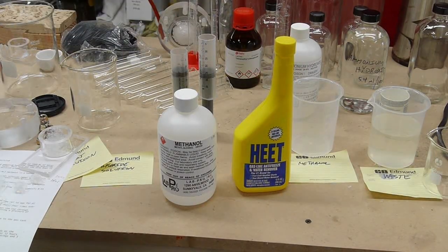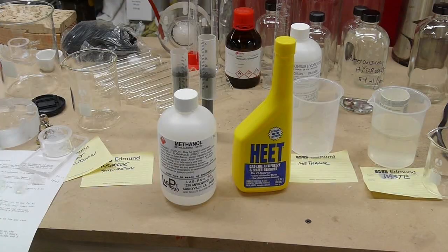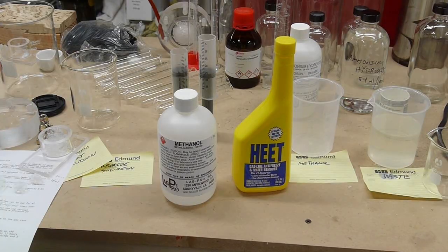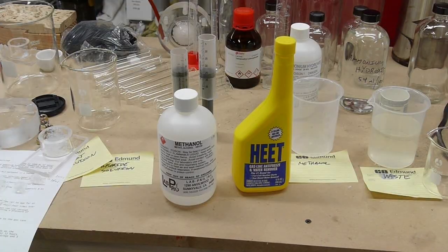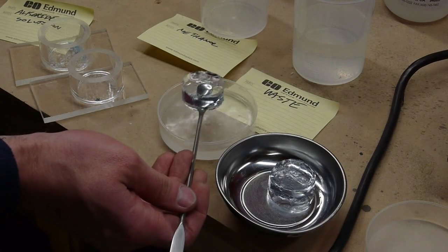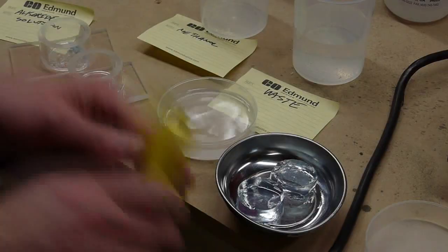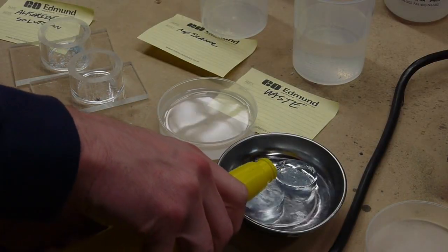So the idea is that after you make this gel, you want to remove that remaining amount of water, because the water will be a problem in the drying process. So your gel is mostly methanol with a small amount of water, and the way to get the water out is to keep changing the solution that it's soaking in. So when you first create the gel, maybe it's 2% water. So you soak it in methanol, and the water will slowly diffuse out into the methanol. Then you dump that methanol out, replace it with fresh 100% methanol, and get a little bit more water out of the gel.